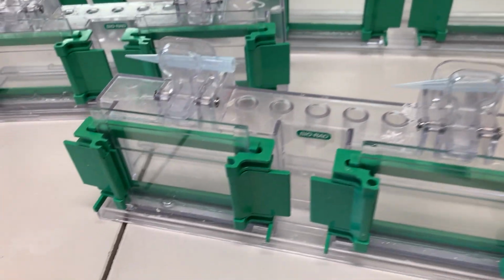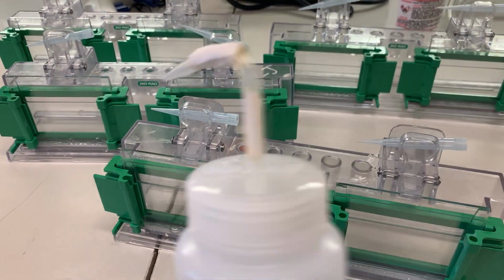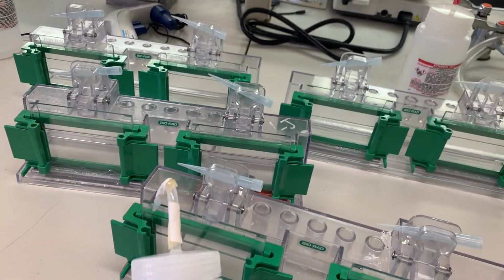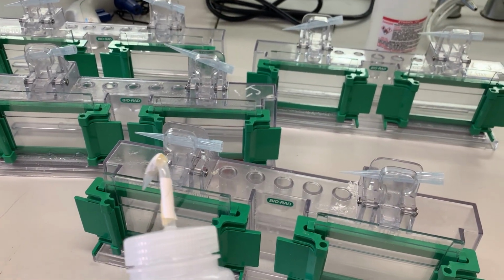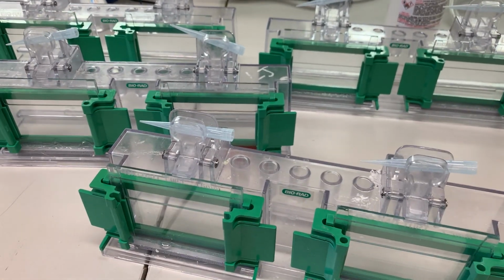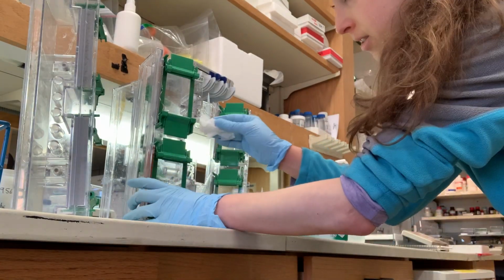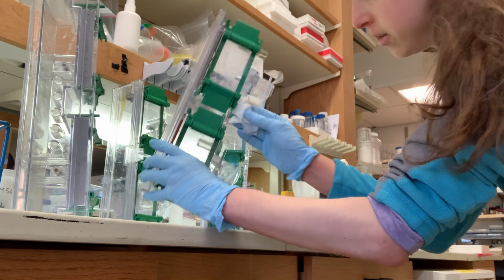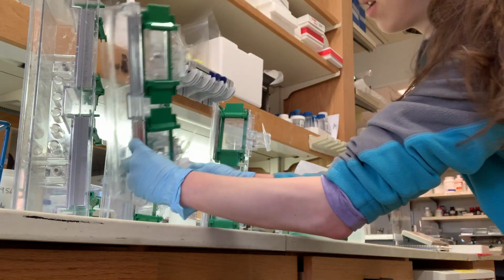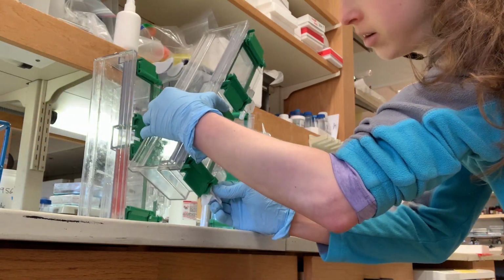First I need to pour off the isopropanol, so I'm just going to tilt it and pour it into the sink, and then use this nice double distilled water. I'll run it over, pour it out, do a couple rinses with the water to make sure everything gets off. Now I've rinsed them off, and I'm going to help get the excess liquid out with a little Kimwipe in the corner, because I don't want the water to be there when we add the stacking mix.